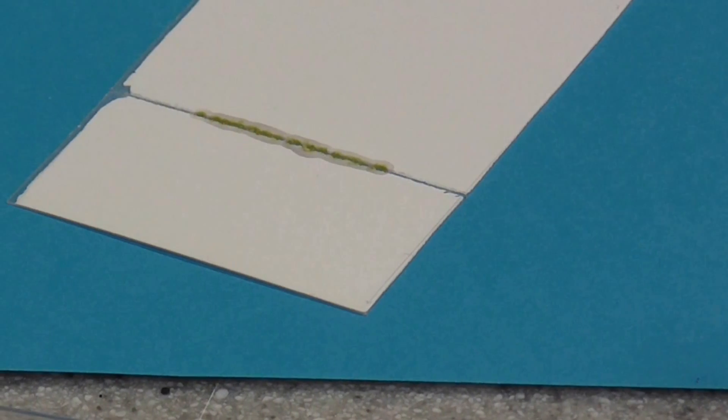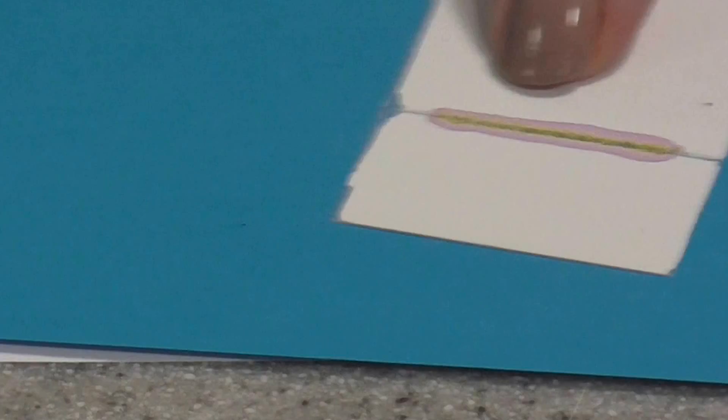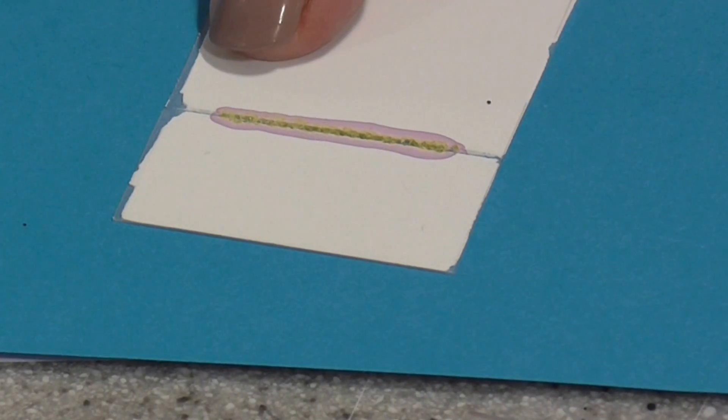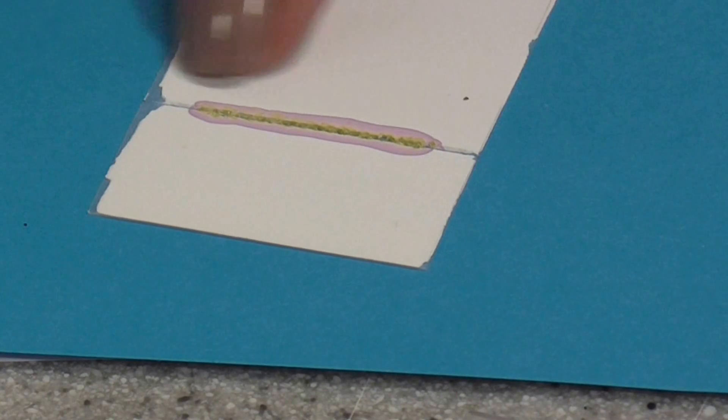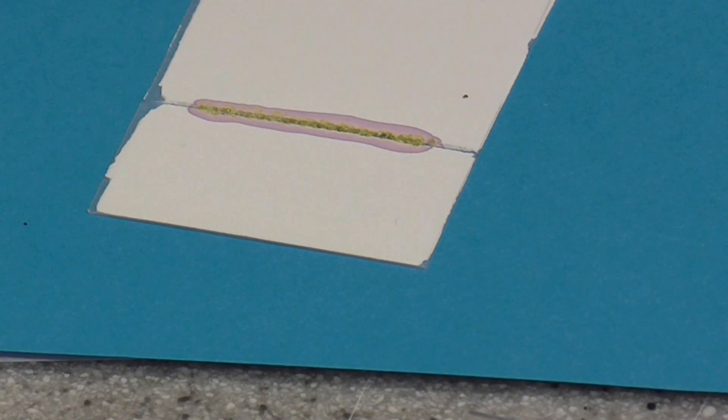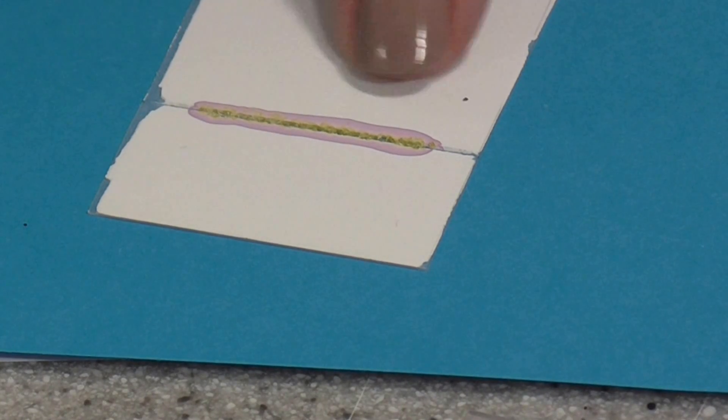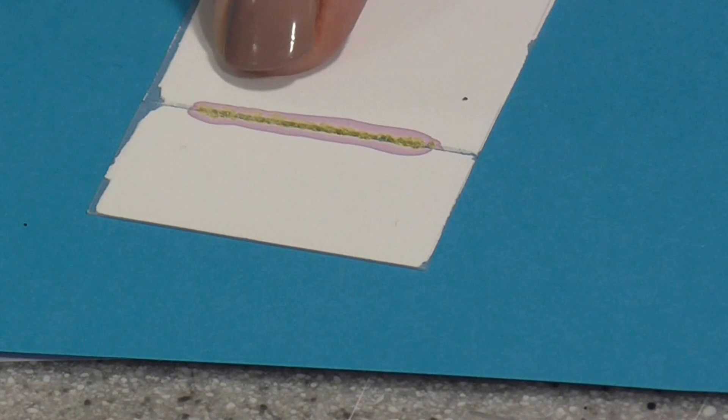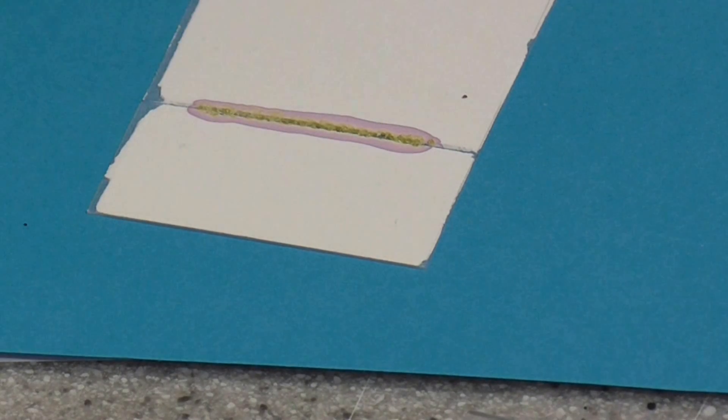Now, here is one of those that I started making earlier. I've done this about 6 times to get a very, very concentrated line and allow it to dry a little bit between each application. You need to be very patient and do this for maybe 30 times so that it's very, very concentrated there. So you know you're going to get your plant pigments.